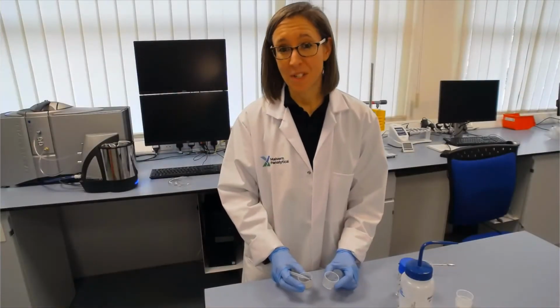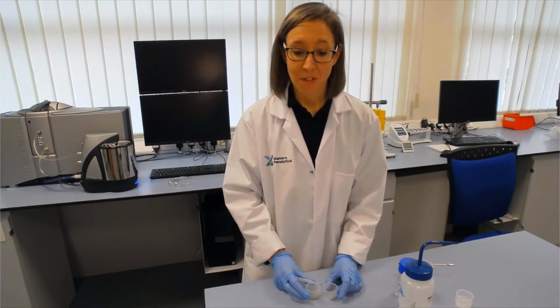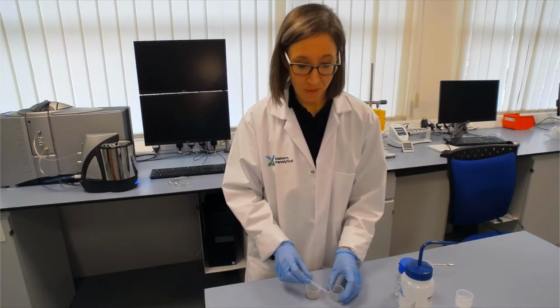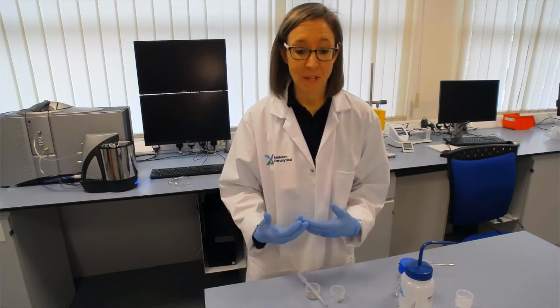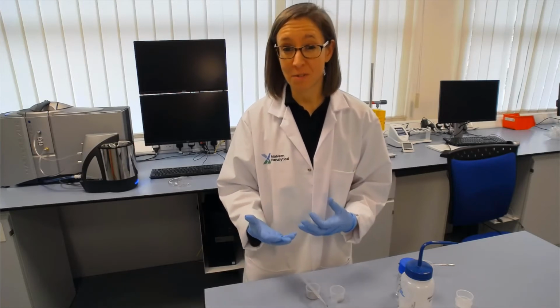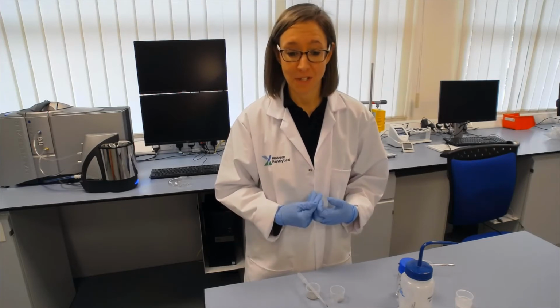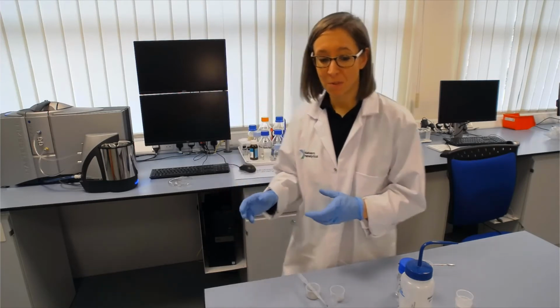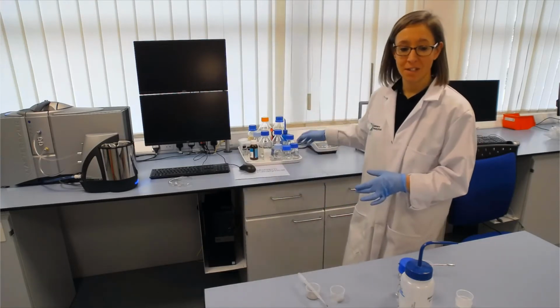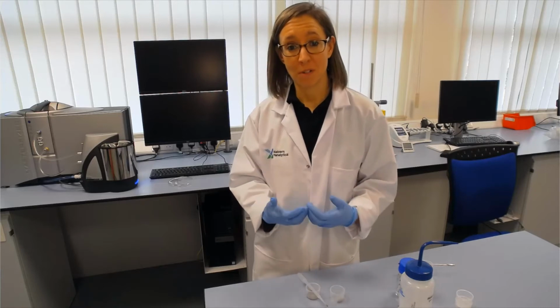So that's the first thing I would do whenever we get a new material, is to do a wetting test in a beaker and see what surfactants work best for you. Now, you'll understand the chemistry of your materials much better than I do, and there are also articles that you can use to help you to understand how to disperse powders into liquids. In this lab, we test a lot of different materials, and we've got quite a range of different surfactants and additives made up, so you can just try a few out and see what wets your sample best.